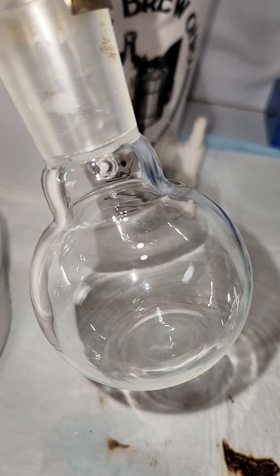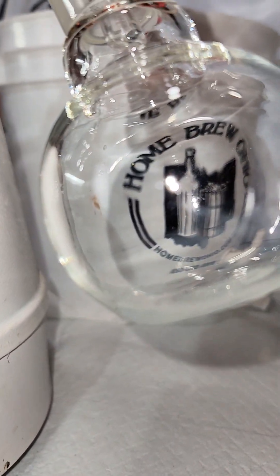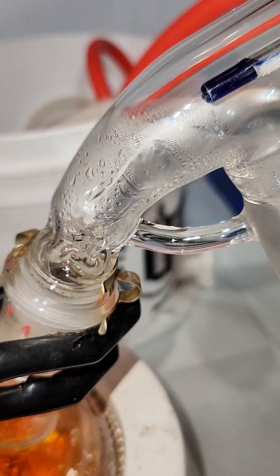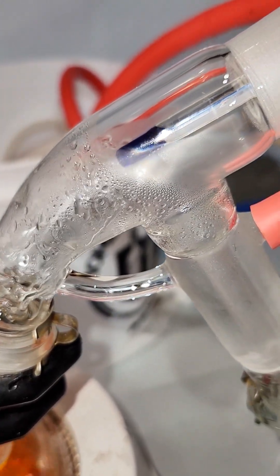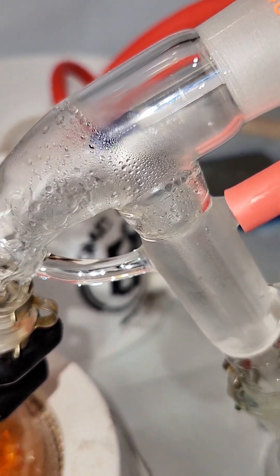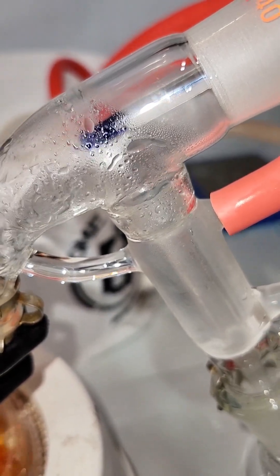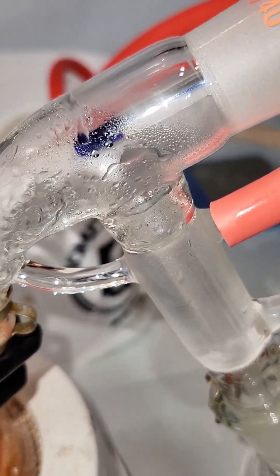One thing that threw me off here is I checked my thermometer when the benzene began distilling, and I noticed it only read 78 degrees. It took me a minute to figure this out, but it looks like some alcohol just traveled too far at my thermometer and got stuck there, so now all my readings are wrong, I guess.